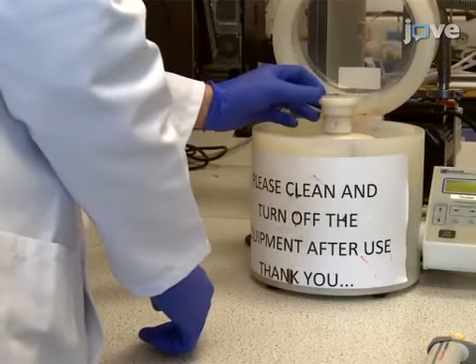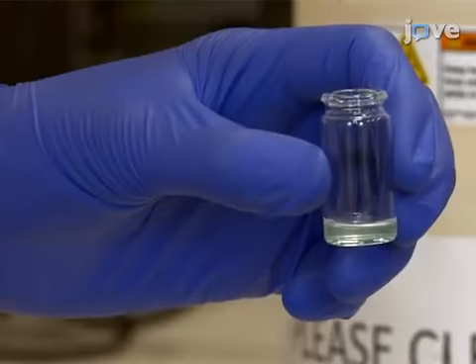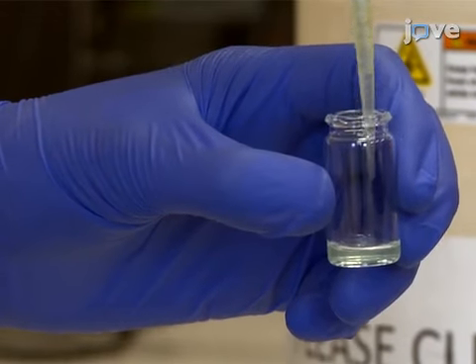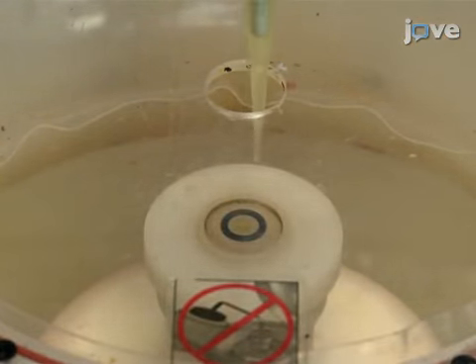Next, spin coat the colloidal dispersion onto the prepared glass slide substrate. Prepare to load 100 microliters of the diluted colloidal solution onto the slide. Once at 2000 RPM, gradually deposit the suspension onto the center of the slide. Spin for 30 seconds from the start of the deposition.